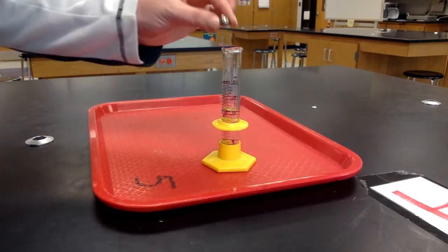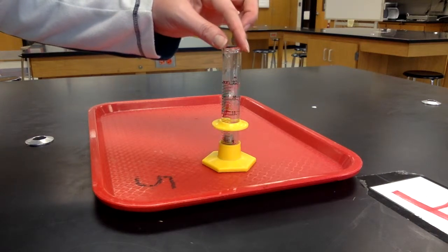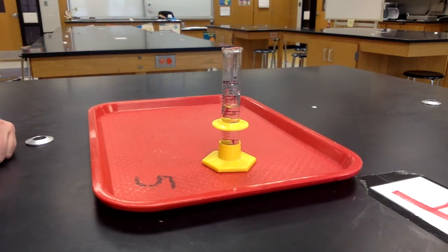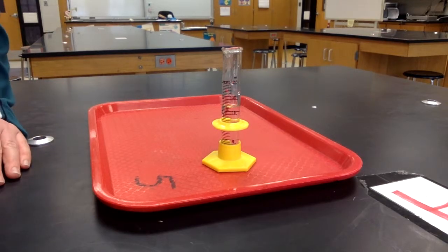I then place the object inside the graduated cylinder. The object will displace or move out of the way the amount of water, the amount of space that it takes up.